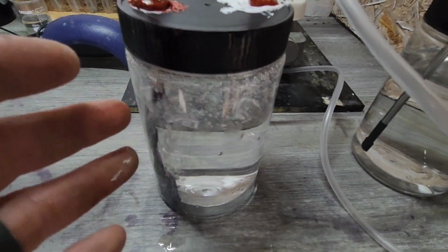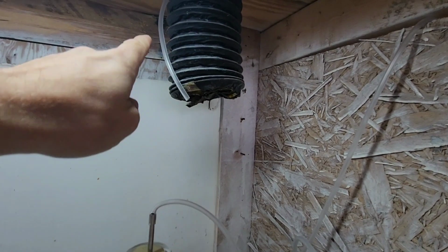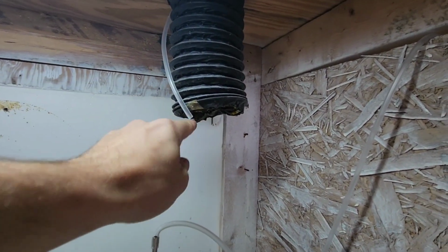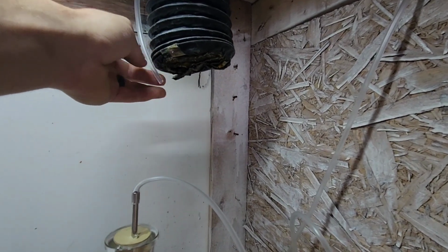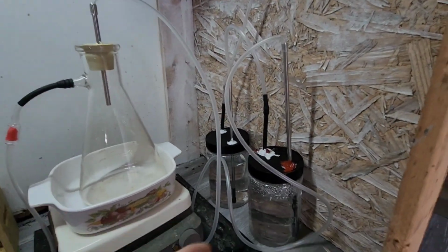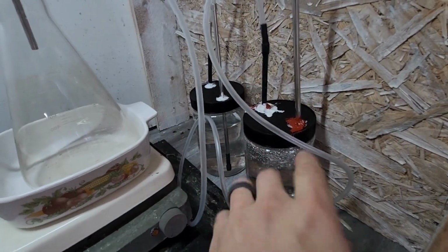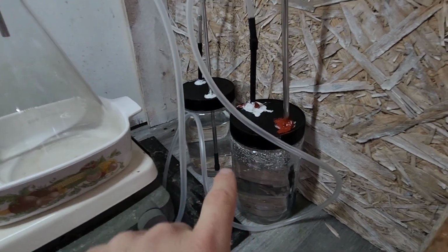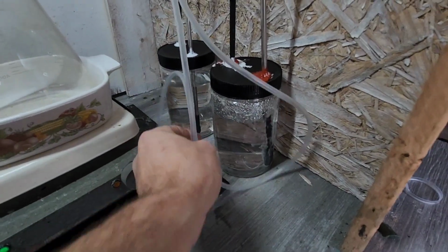So let me get it set up where I want it, and then we'll test it out. It moved to where I want it to be. The hose is going to come down here, so this will be the final hose. If we do get any left, it's going to come right out and then into my vent hood. So it's going to sit here for now, just so it's contained, because I know we're going to lose some out of here, and I don't want it outside my vent hood. But I think we're on the right track, and I think we're going to let it ride for now.